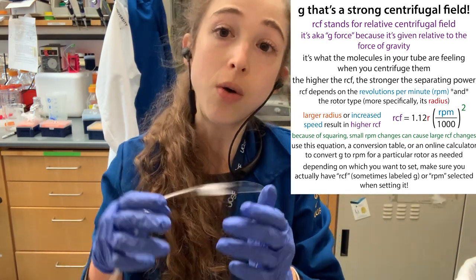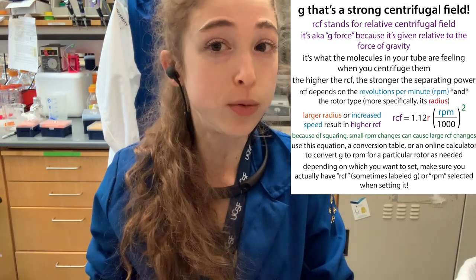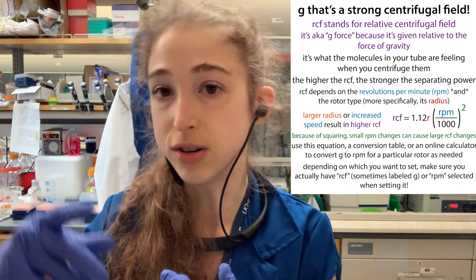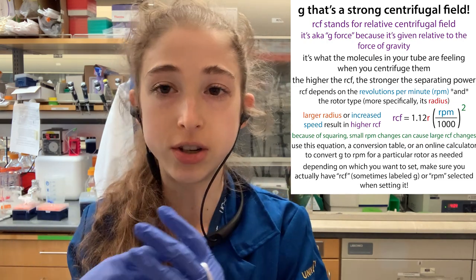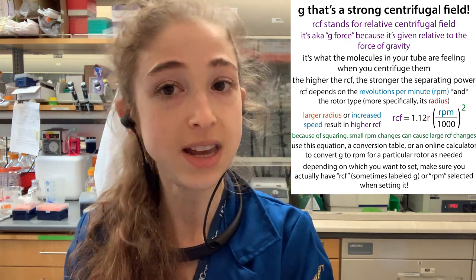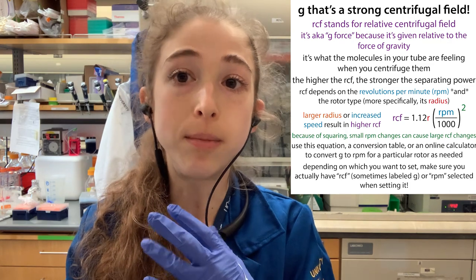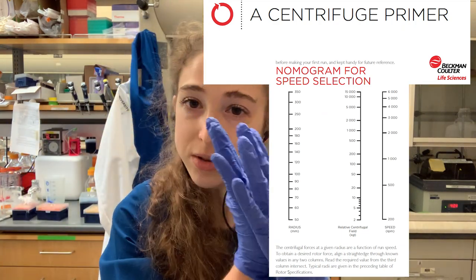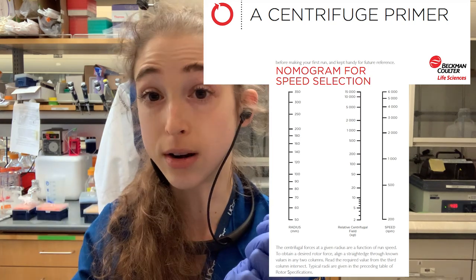This is why knowing the RPM doesn't automatically tell you the force being applied. But you can convert between the two if you also know the radius. Some centrifuges know what rotor you've put in and will do the conversion for you. Other times you have to do the conversion yourself using online calculators or a nomograph, where you take the two things you know and draw a line to find the third. The centrifuge can control RPM but can't directly control RCF because that also depends on the rotor.